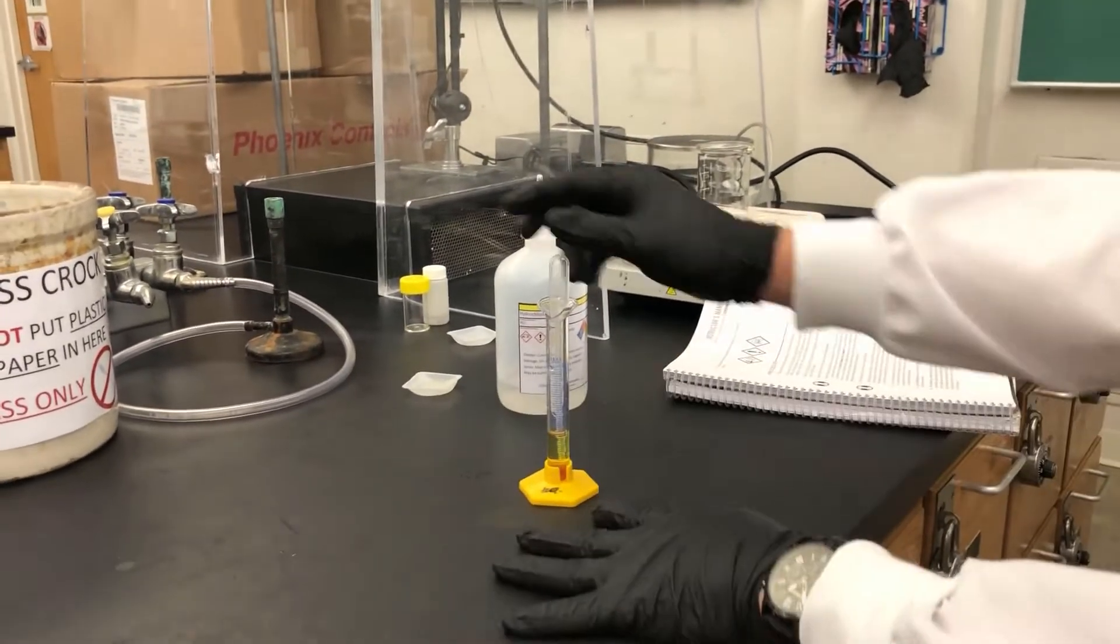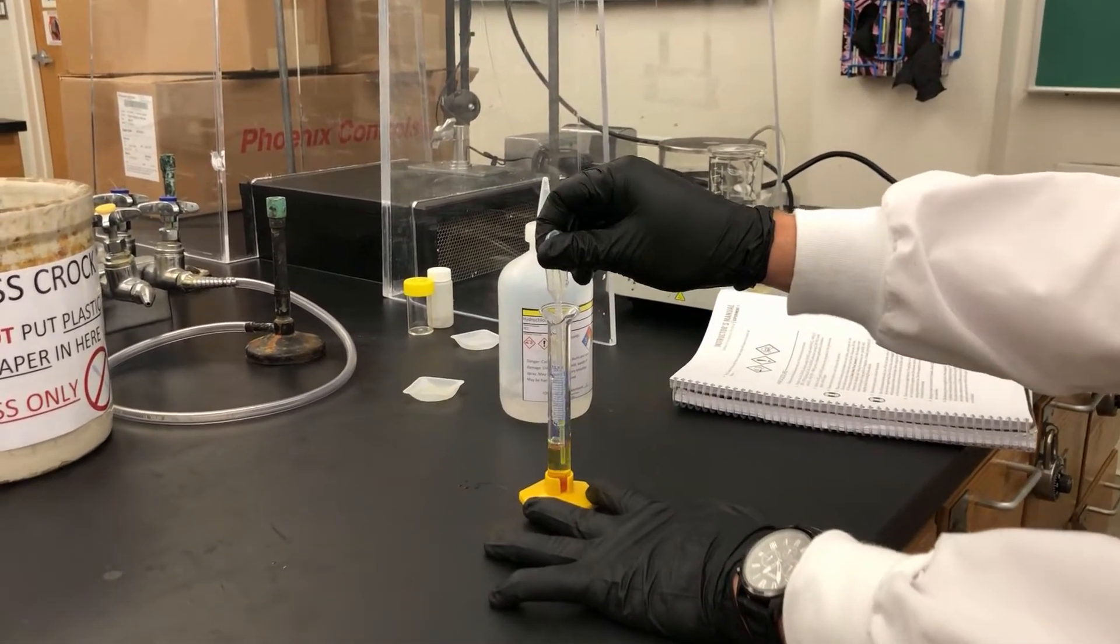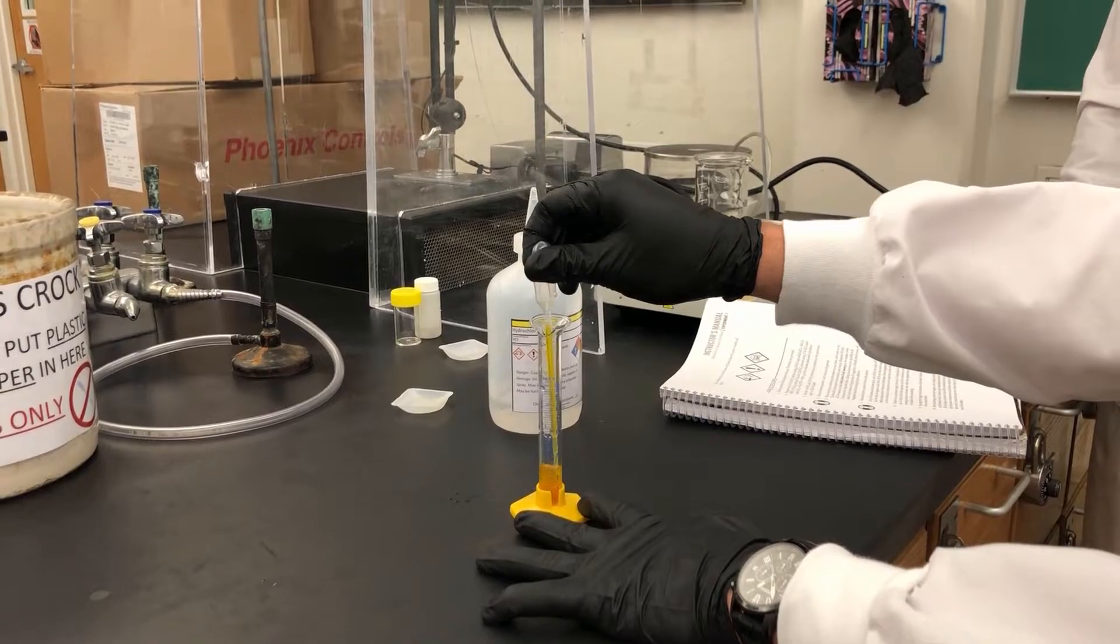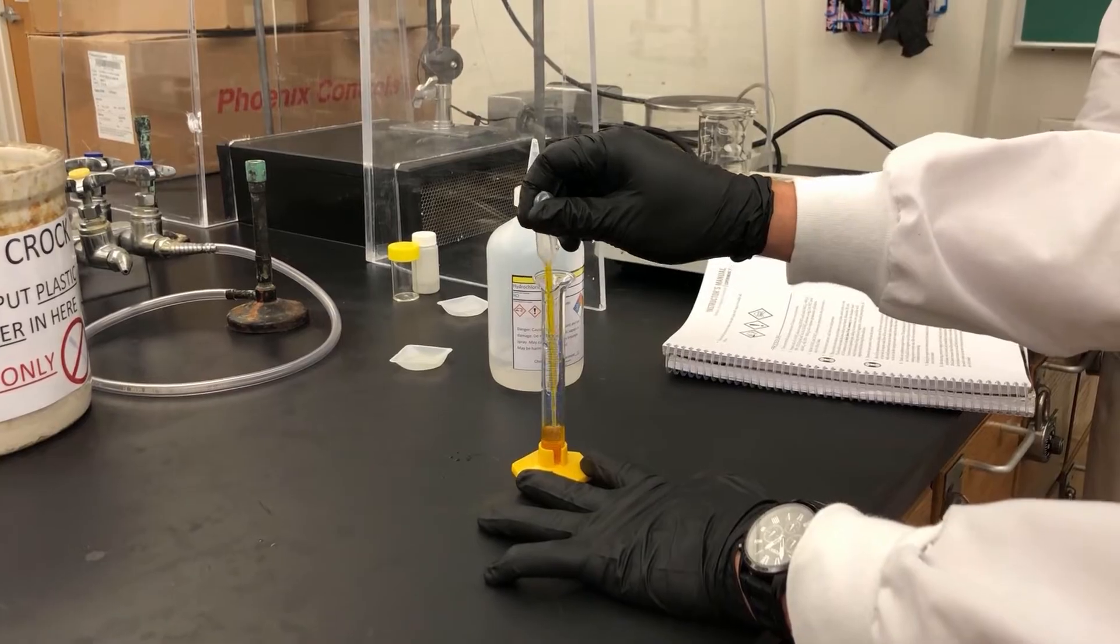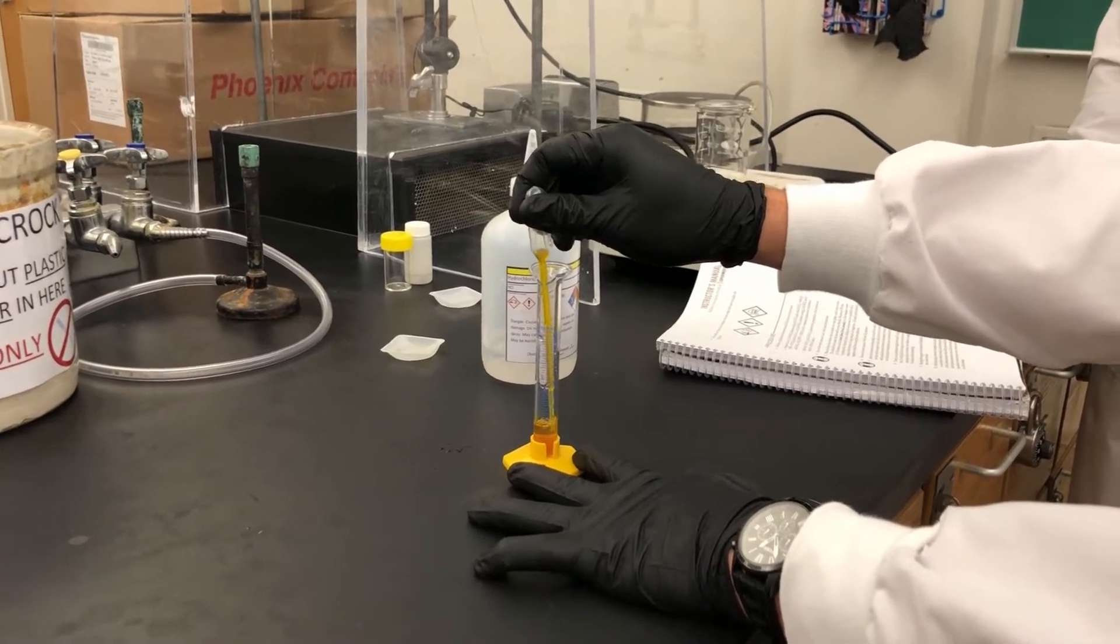Okay. To mix this, I'm going to pipette up and down to thoroughly dissolve the iron 3 chloride hydrate.